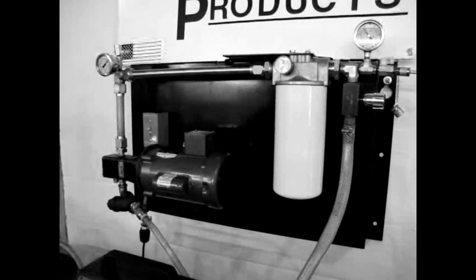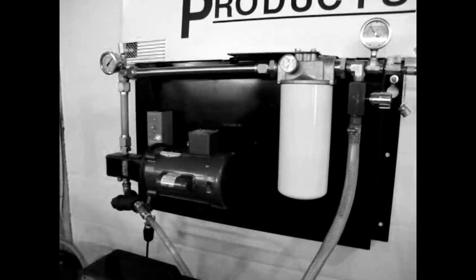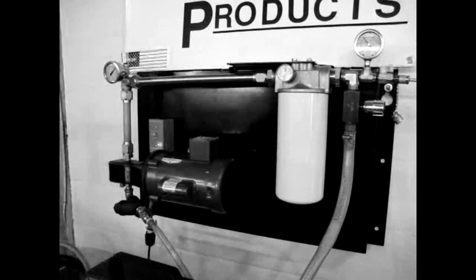Let's see how we do in the second part of the test. We're utilizing an absolute rated Beta 1000 microglass 1-micron filter for this test.